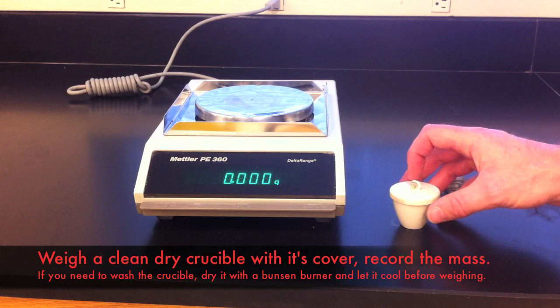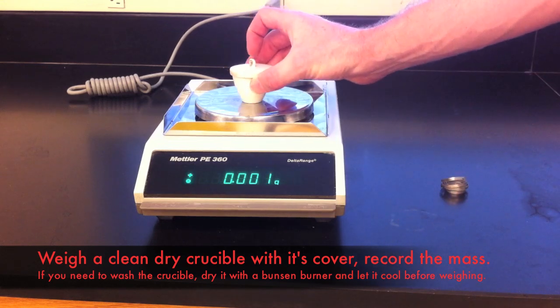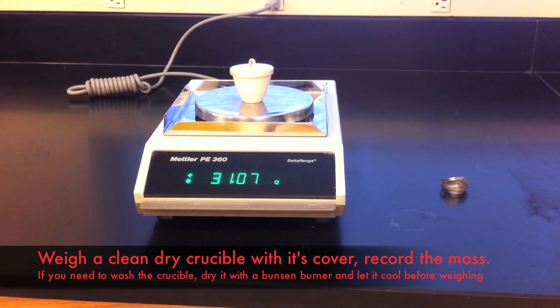To begin, you will need to determine the mass of a crucible and its lid. Make sure they are both clean and dry before you weigh them.